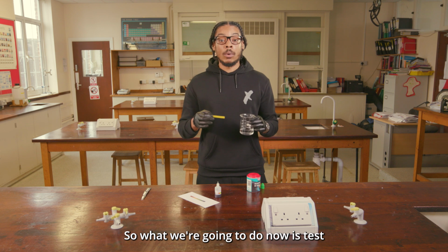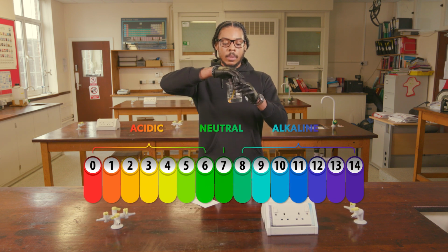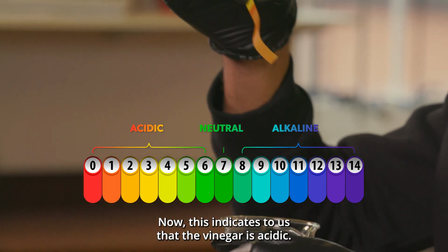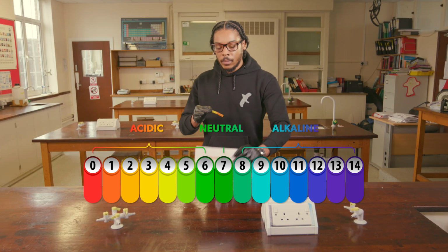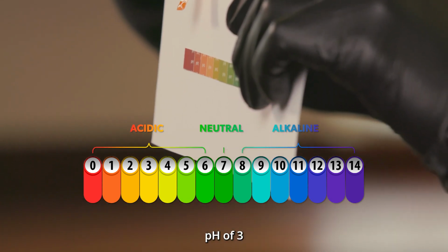Right, so what we're going to do now is test the pH of the vinegar using some indicator paper. Now we can see that the indicator paper has turned orange. Now this indicates to us that the vinegar is acidic. If we look at the pH chart, we can see that the vinegar has a pH of 3.